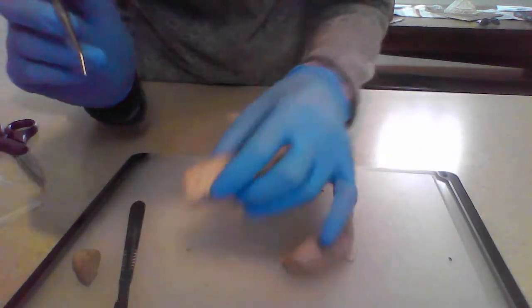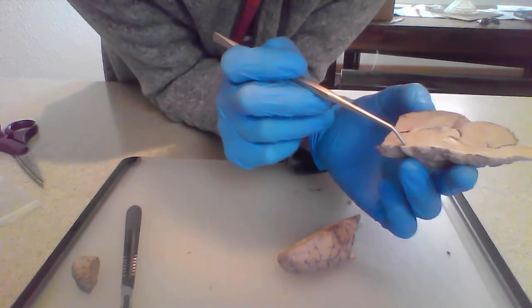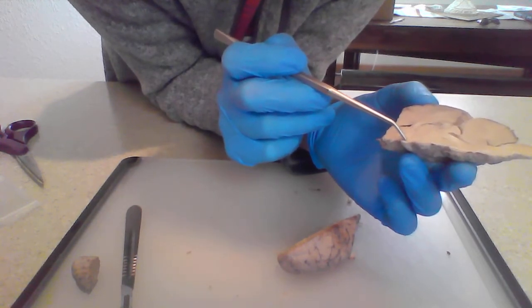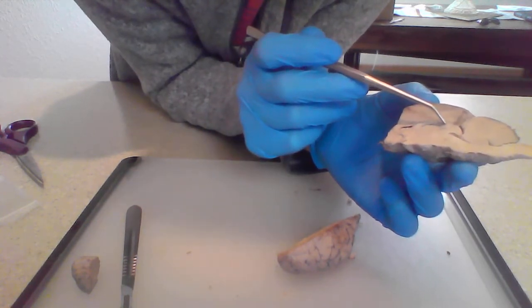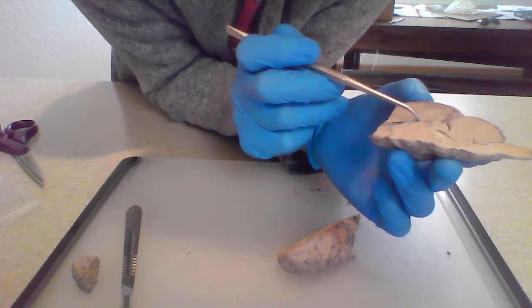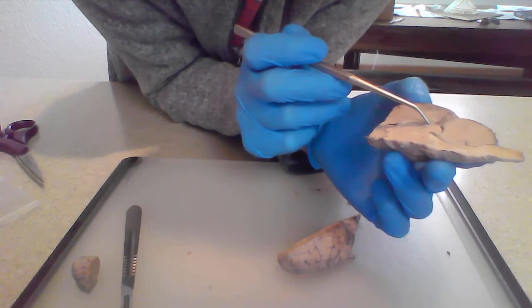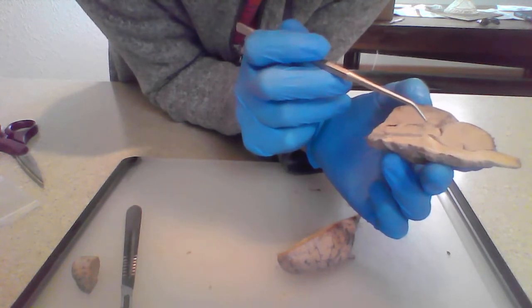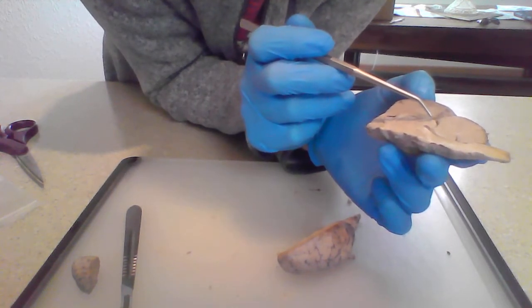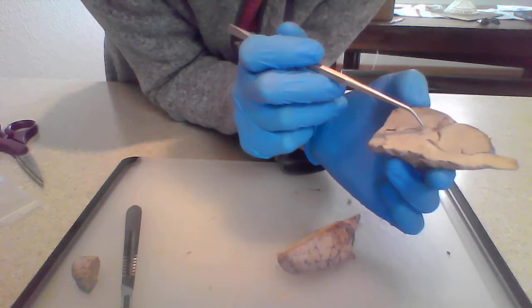And we're going to switch over to this one because I think it's a little bit better. Down here, we have the hypophysis, or the pituitary gland. I believe that's what that is there. And then we also have the pineal body, which is an endocrine gland directly below the third ventricle. And then I believe superiorly to the pineal body is where the hippocampus would be. And that is all related to your long-term memory.